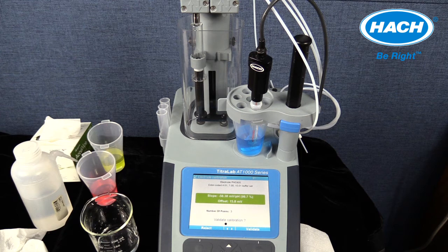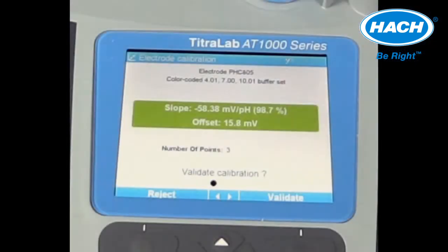This screen will provide the calibration slope in millivolts, the calibration percentage, and the offset in millivolts. The number of points used to create this calibration is confirmed, and the option to validate the calibration can be selected. The calibration percentage is a calculation of the measured slope divided by the theoretical slope of minus 59.16 times 100.